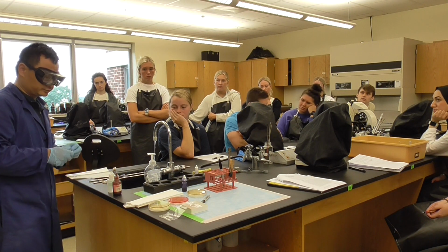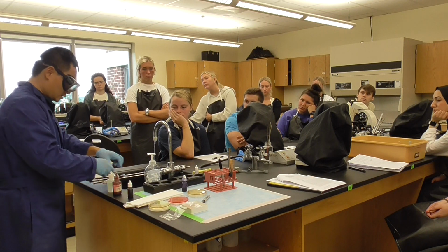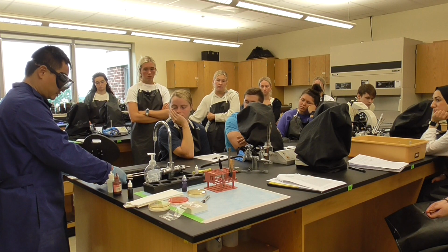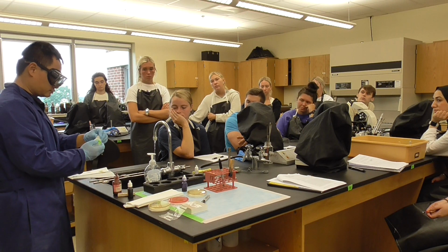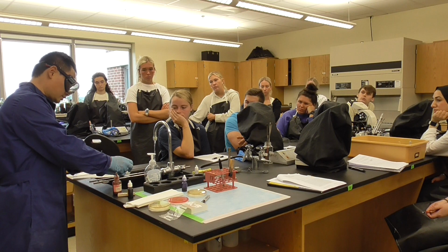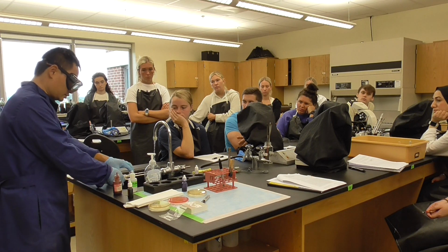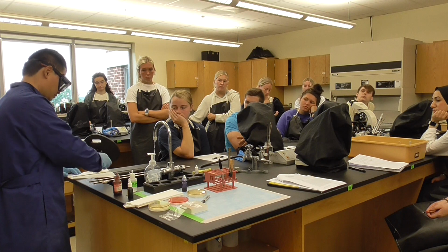This stays strong. And then let's say the 60 seconds is ready. What we're going to do is rinse it. After that, we're going to do the decoloration process. For decoloration, we're going to use alcohol, so that will be 10 seconds. We're going to do it very quickly, counting 10 Mississippi, 10 seconds, and the alcohol is ready. The decoloration is gone.